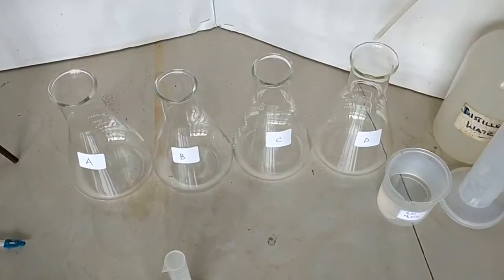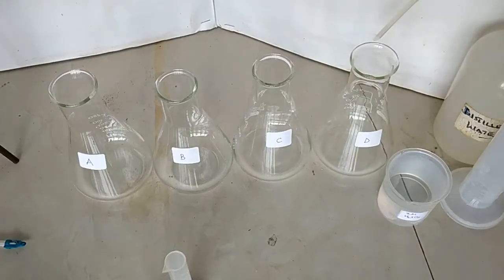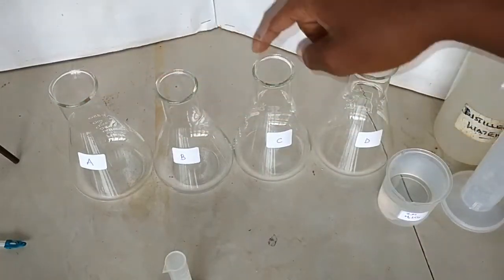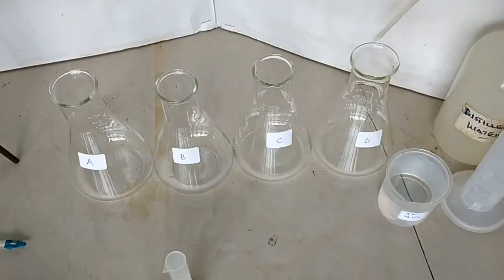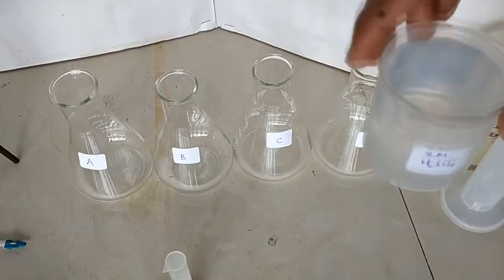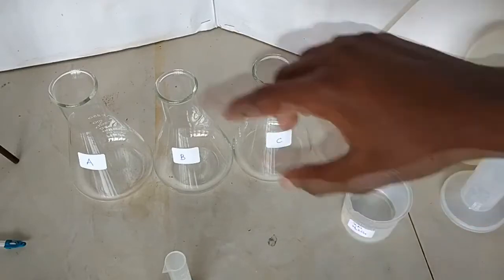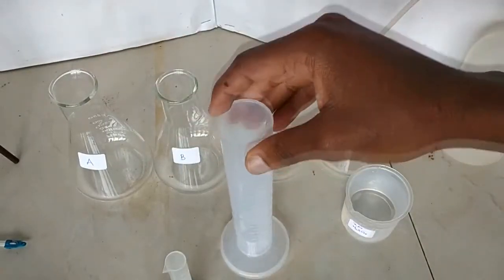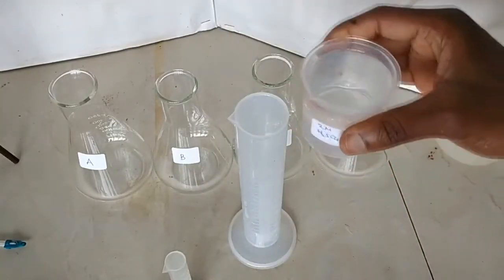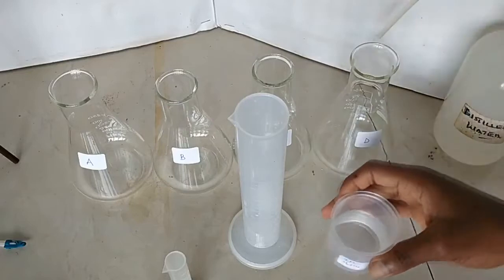Today we are going to determine the effect of concentration on the reaction rate. We have four conical flasks A, B, C, and D. We are going to measure 40 cubic centimeters of 2 molar sulfuric acid and put it in flask A, using a 100 ml measuring cylinder.